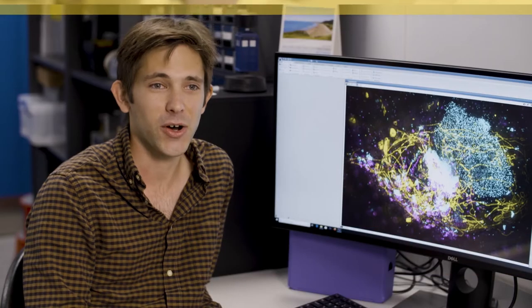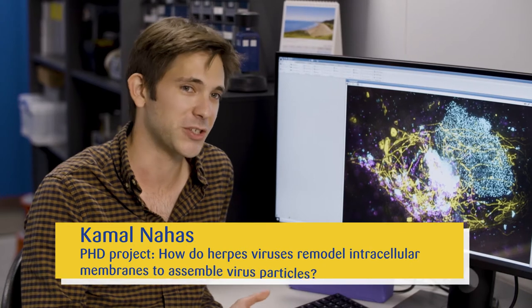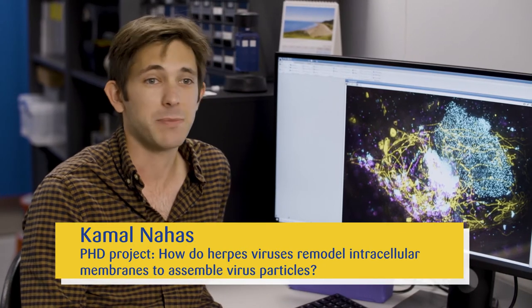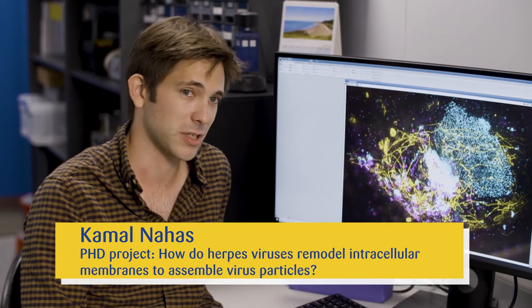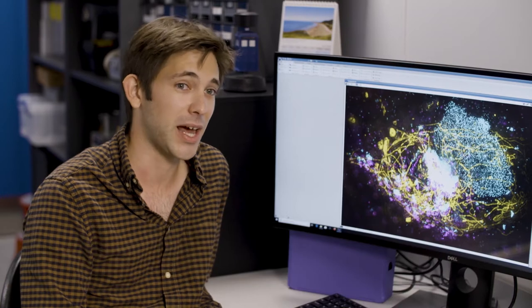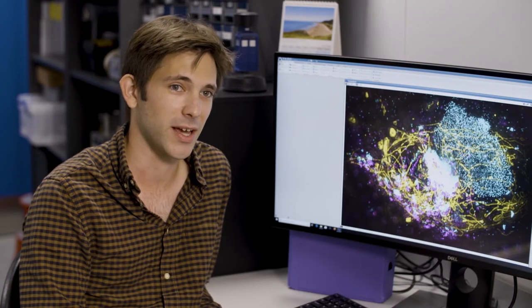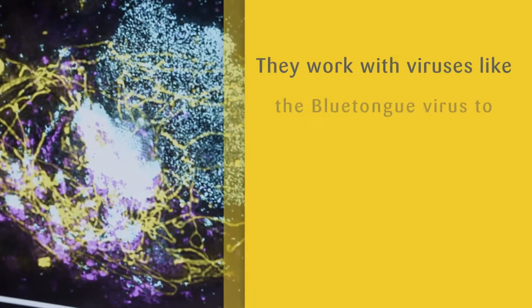We use a technique called SIM, or structured illumination microscopy, which is a specialized form of light microscopy that allows us to study the components of the cell in extremely high resolution.